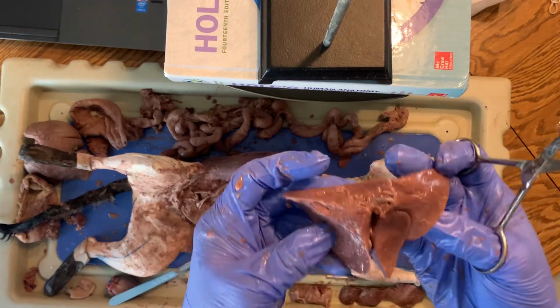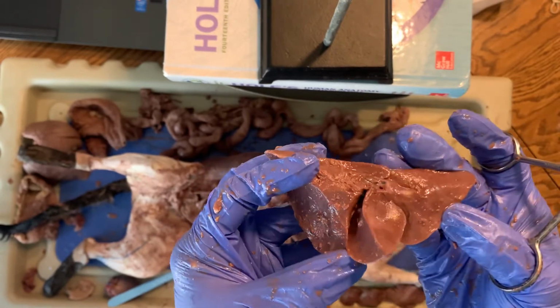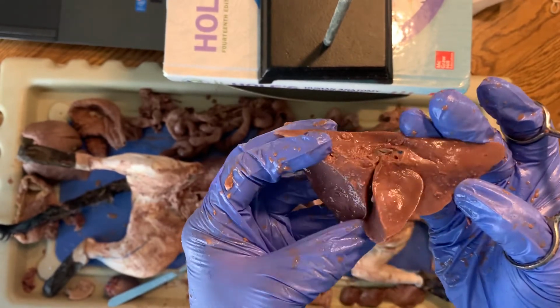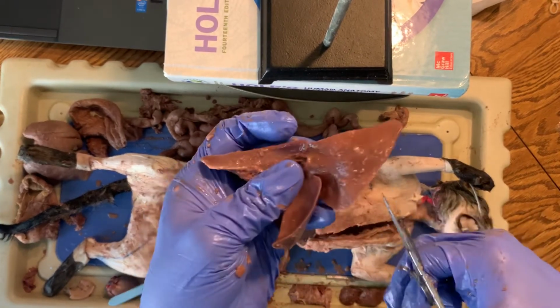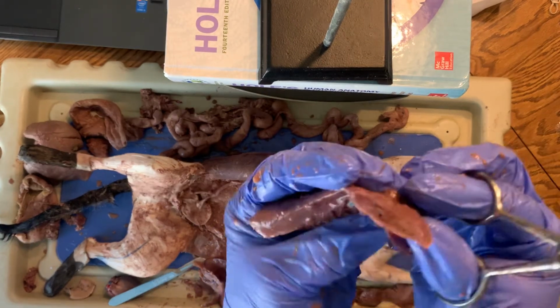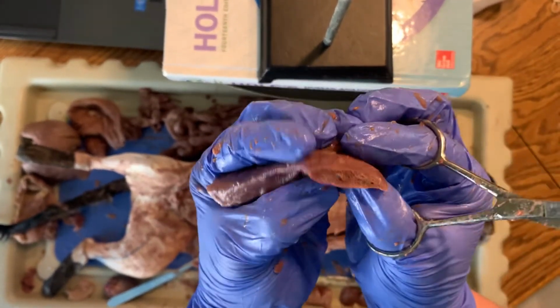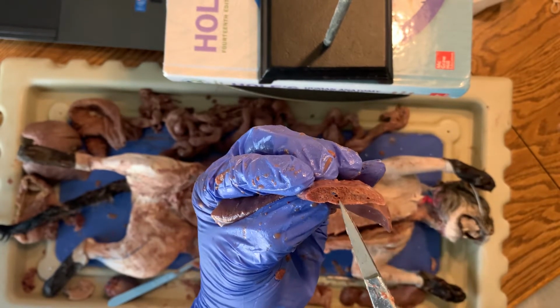And so they have multiple lobes to their lungs just like we do. We have 3 and 2. They have like 7 and 5. They have lots of lobes. And lung material is not completely a hole or a bag. It's very spongy-like in consistency. But again, you can see lots of microscopic holes and larger holes going in.